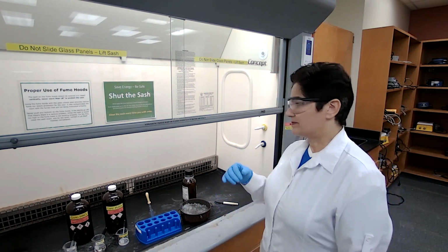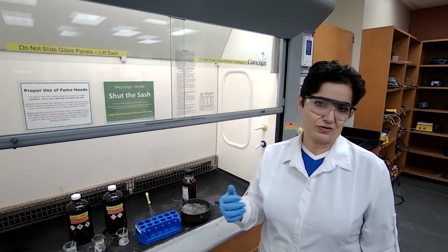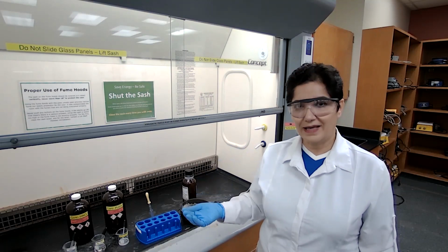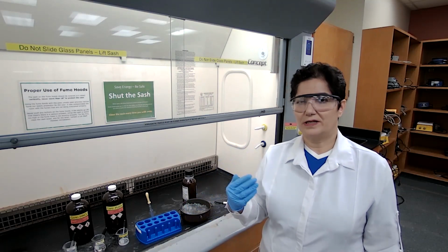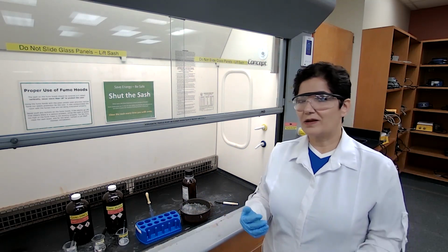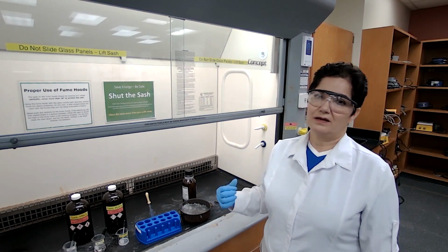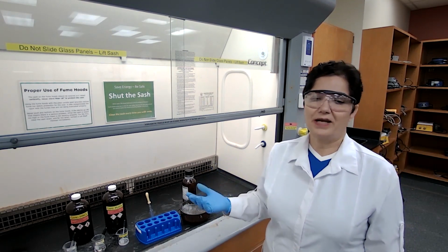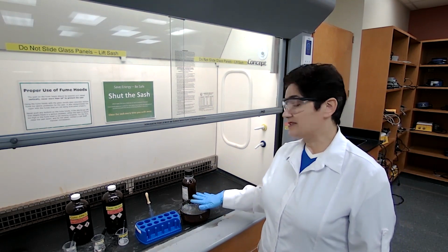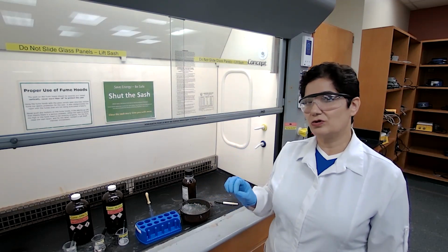Some yellow color is fine, but if you see the mixture get a dark orange or brown color, it's best to start again because you don't want to have the byproducts of dinitro or trinitro. Because it's long, I may sometimes pause the video and then go back to make sure that the reaction mixture is cold enough. Just keep in mind about 5 minutes separately. They are going to stay in the ice to make sure that they cool down.